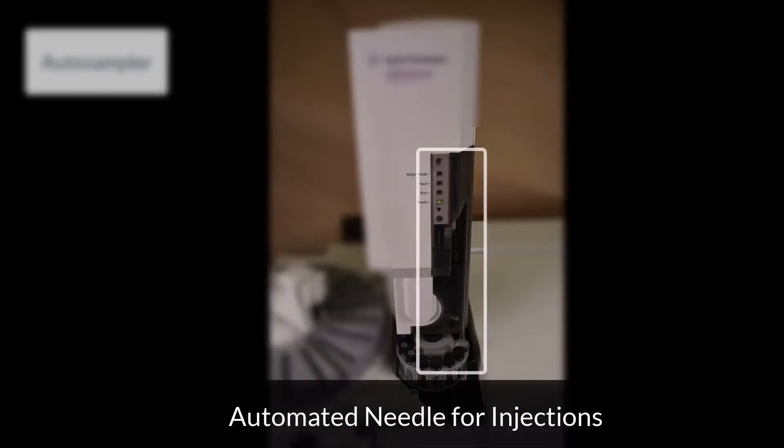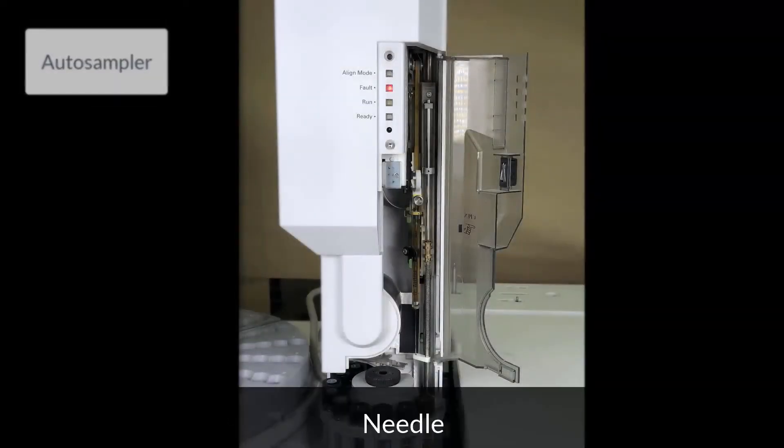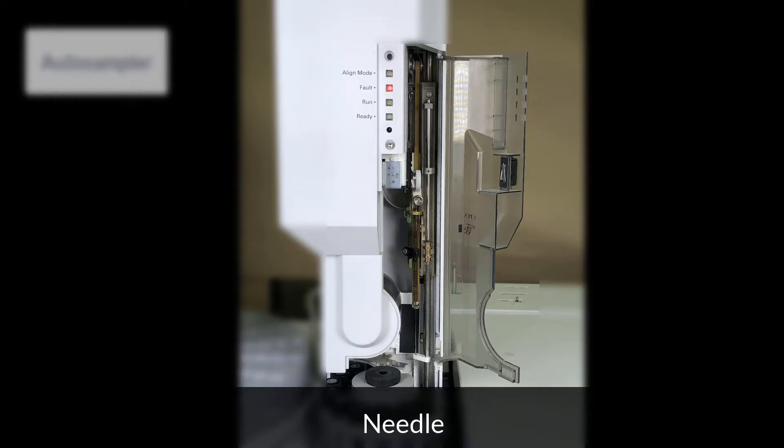This is the injection needle. It is programmed to rinse the needle between sample injections. For how to do manual injection, check out this link.